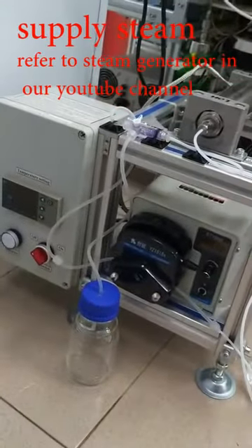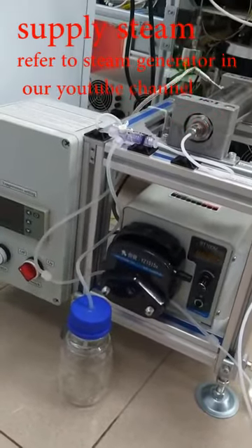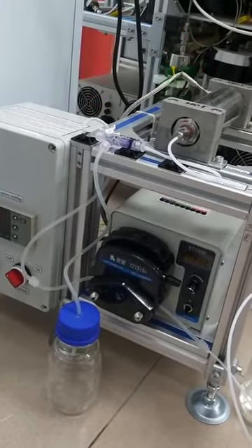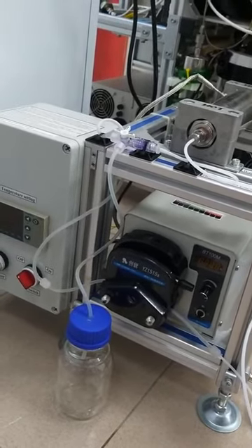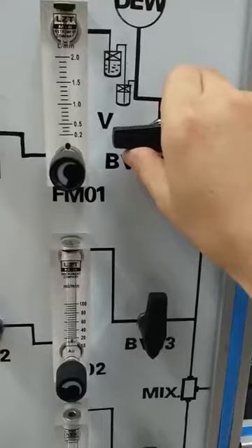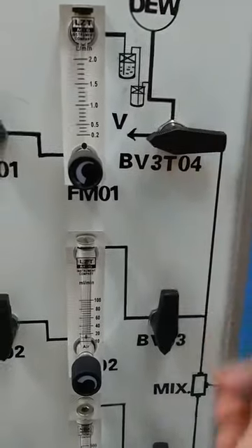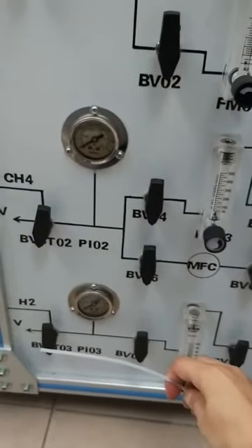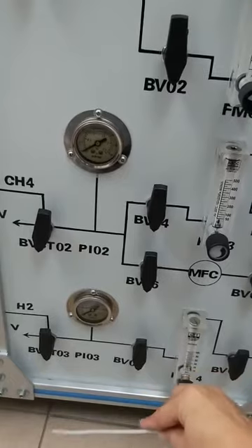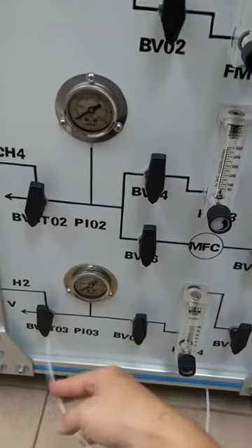Set the steam generator from here, and supply the amount of steam by the amount of water in units of milliliters per minute. Vent the steam and check the steam status from this tube. Take care and make sure this tube is put in some container to avoid burning yourself.